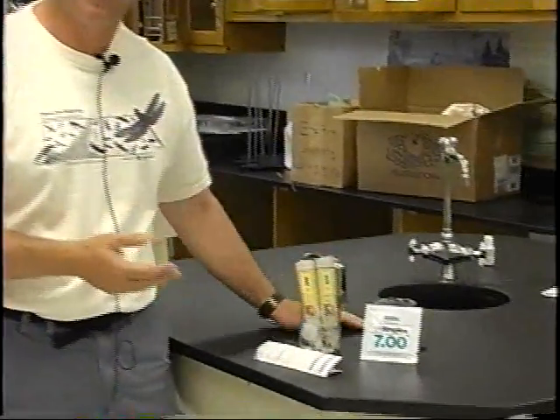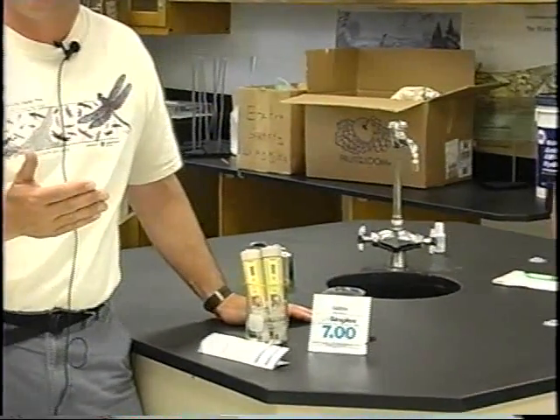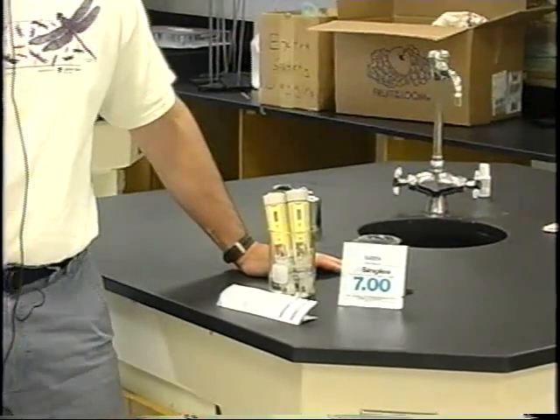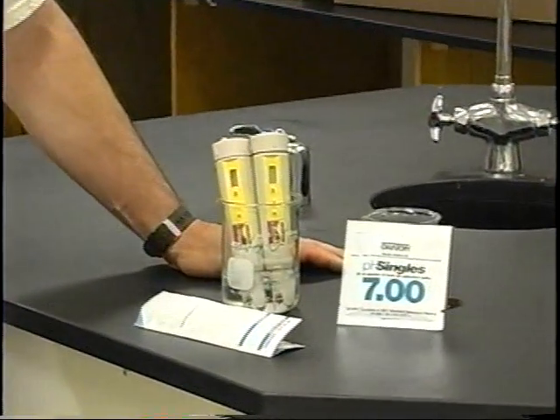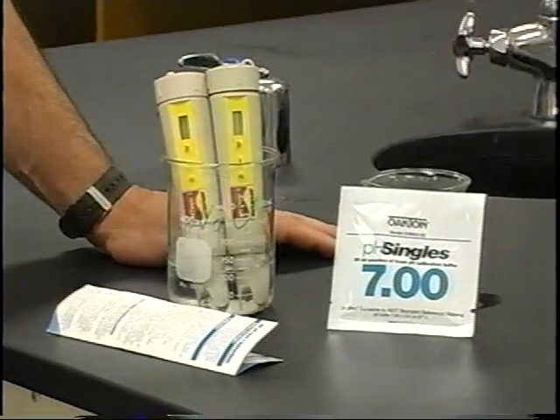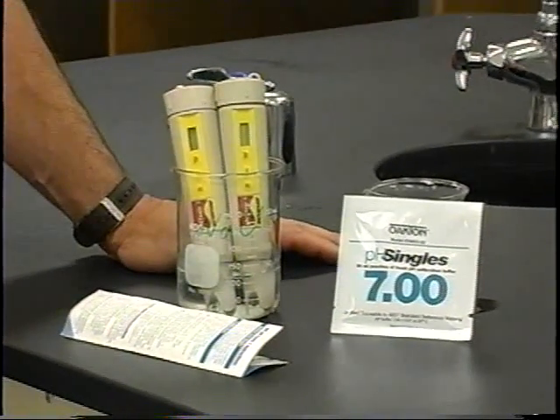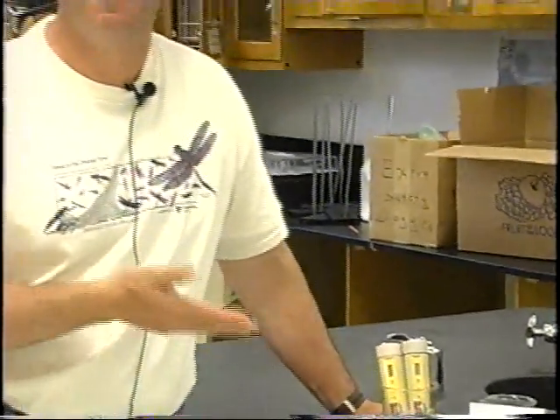I have 2 of them here because it's always nice to have 2 to verify and cross-check your results. If you got one that says the pH is way off the charts and another that says the pH is real low, or one says it's real high, there's probably a problem with your pH meters. Maybe the battery's going bad or the pH meter itself is not functioning properly. But if you have 2 pH meters and they're both reading the pH of the water to be the same, you're in pretty good shape.